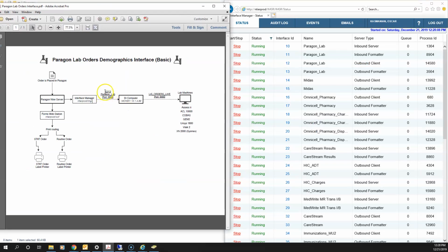I've said that it's interface 12 and 13, right? We have interfaces 12 and 13 here, or actually it's just one interface. One is the client and the other one is a formatter. The client is what sends and receives. The formatter is what converts the messages in order for the party outbound to understand, or the party inbound, which is us, to understand the message. So basically like a translator. So let me go ahead and close this.